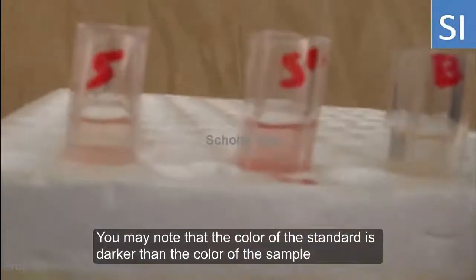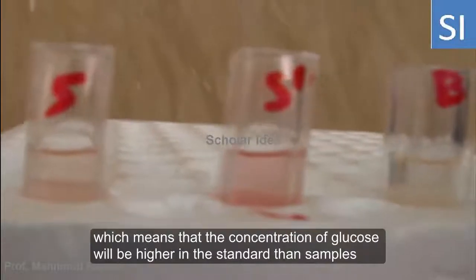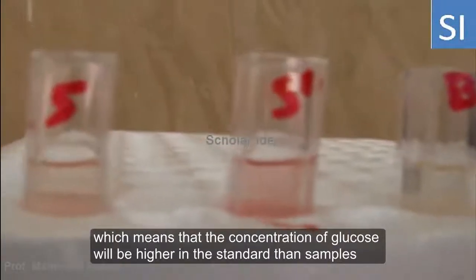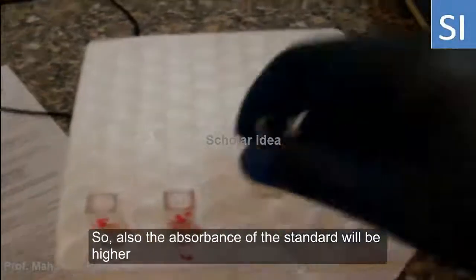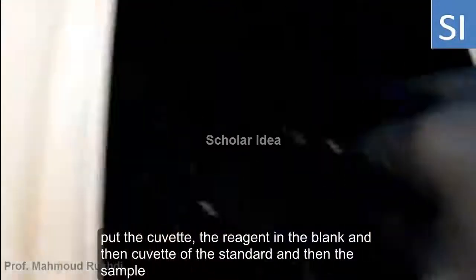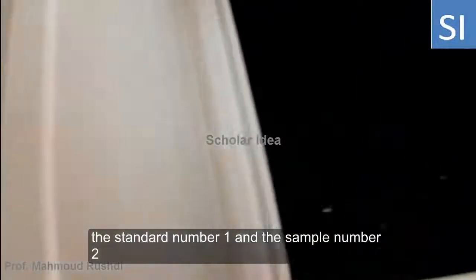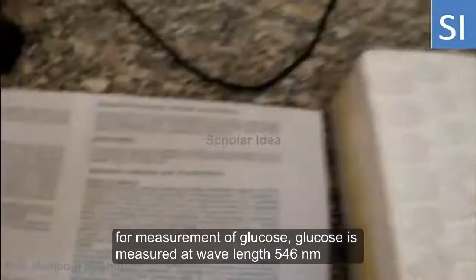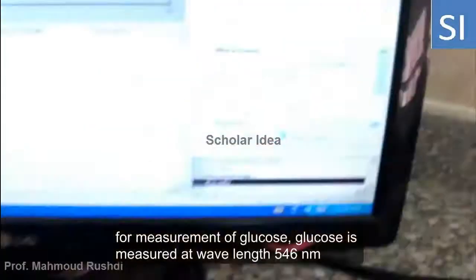The difference is that the color in the standard is darker than the color of the sample, which means that the concentration of glucose is higher in the standard than in the sample. Therefore, the absorbance of the standard will be higher. Glucose is measured at 546 nanometers.